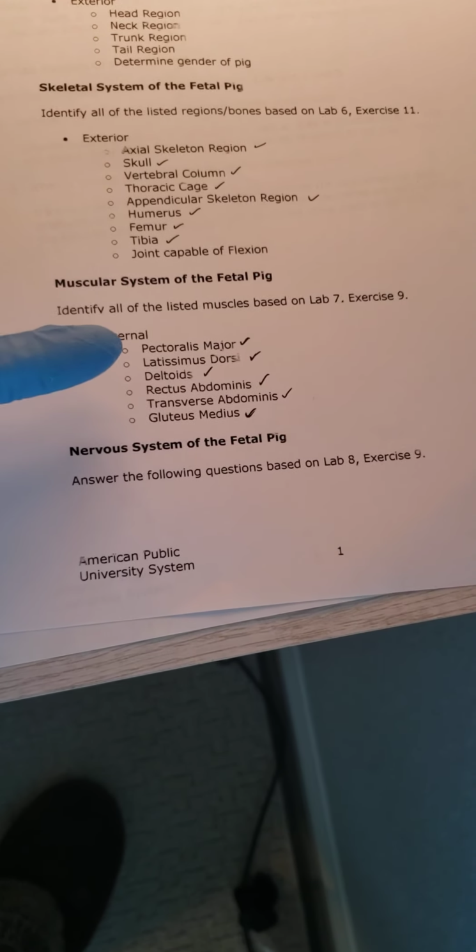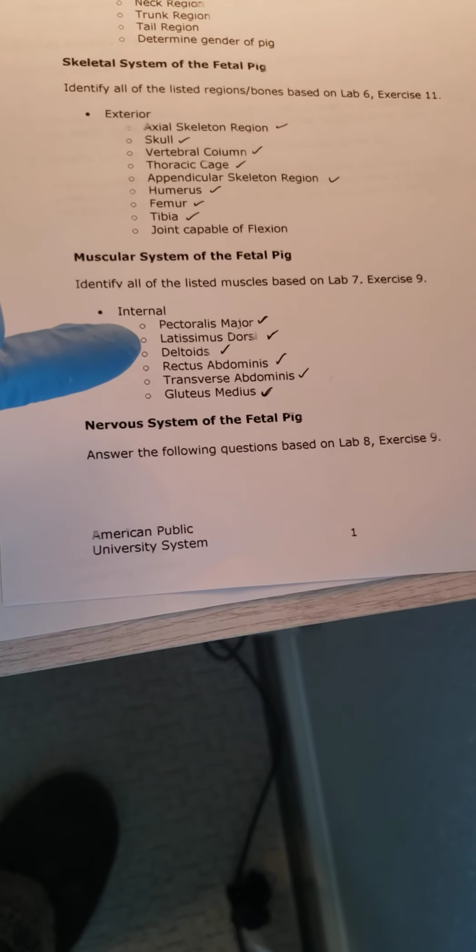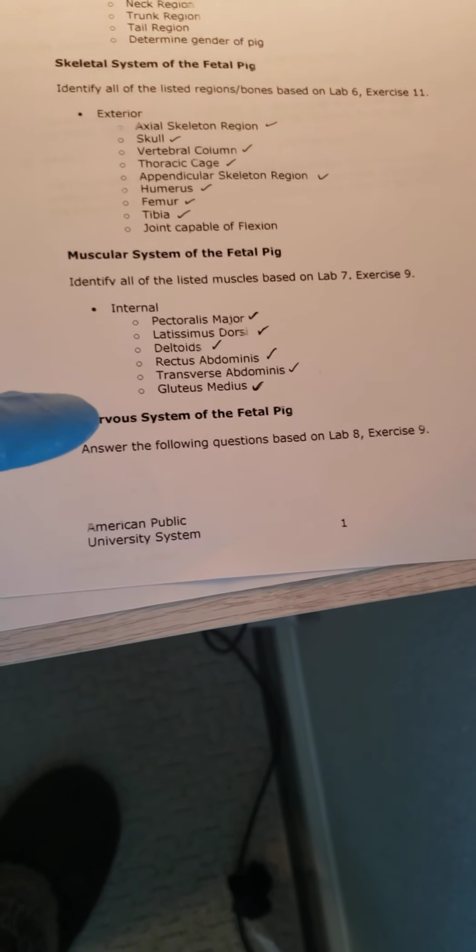Next, working at the internal parts, but really you can identify them on the outside as well. The pectoralis major, latissimus dorsi, deltoids, rectus abdominis, transverse abdominis, gluteus medius. All right, so kind of working from the top, pectoralis major.